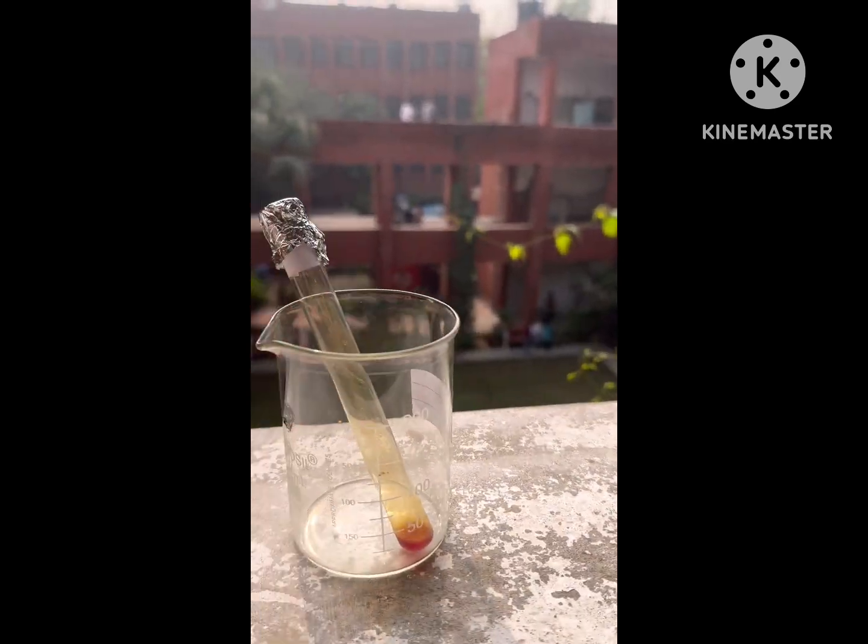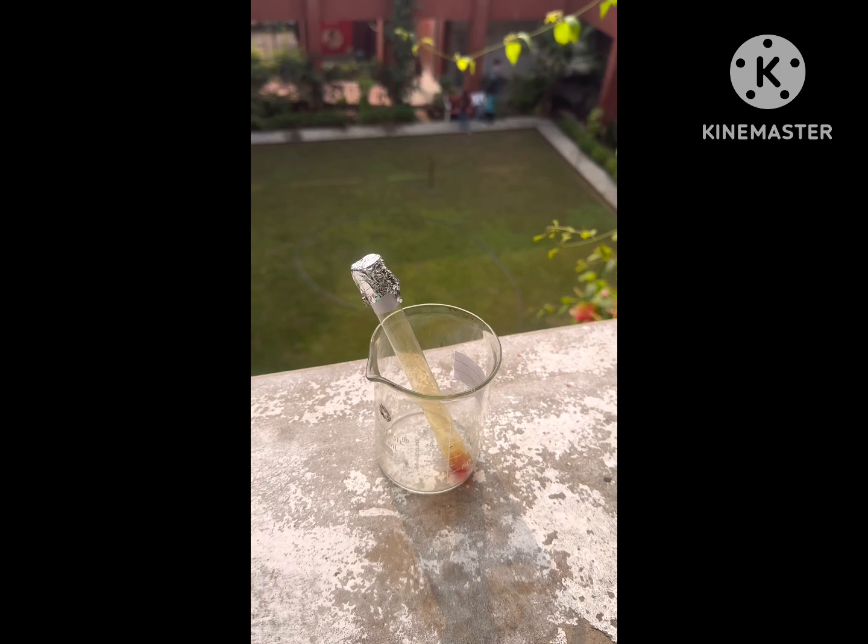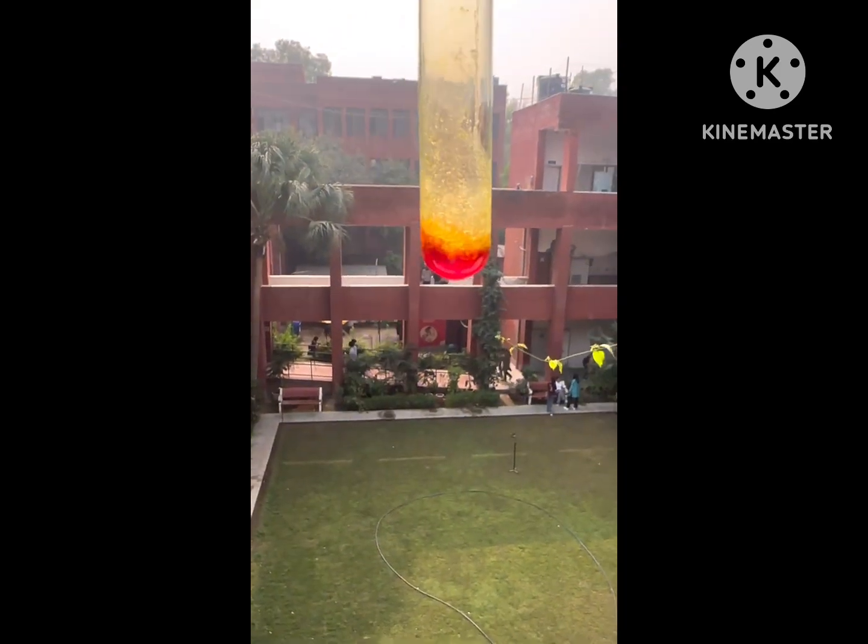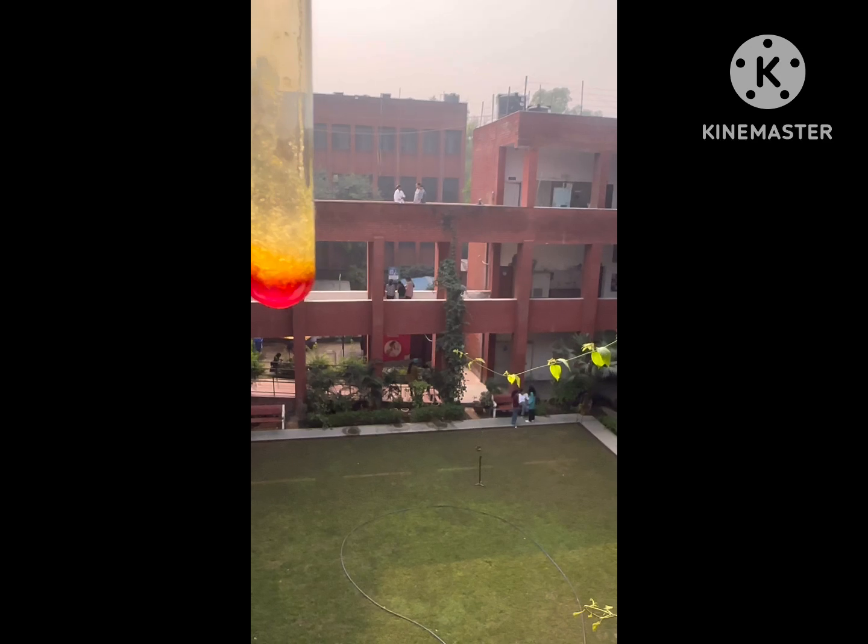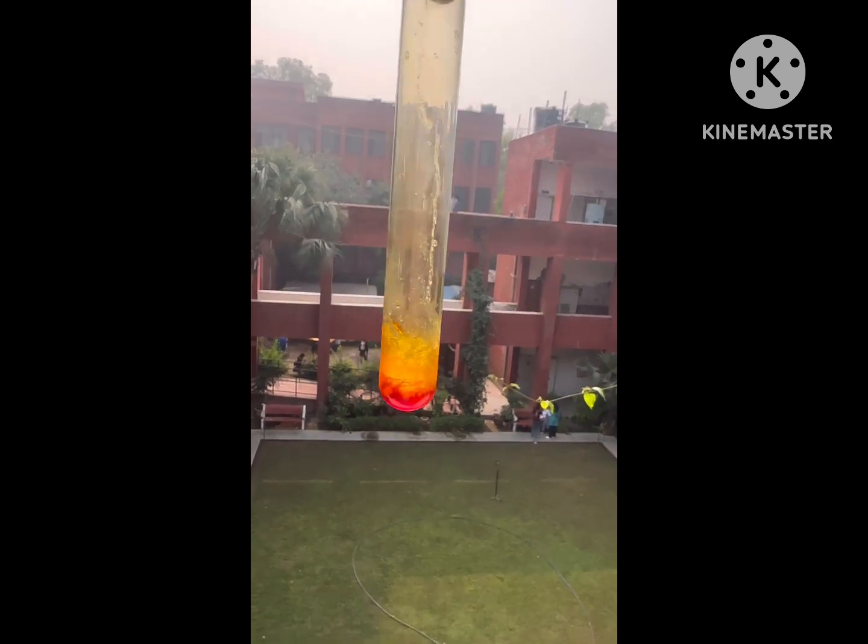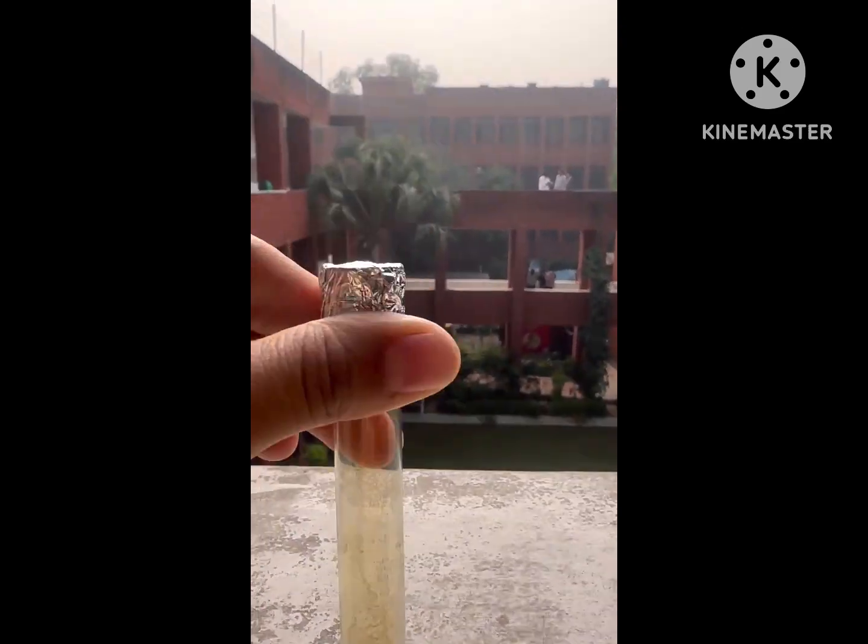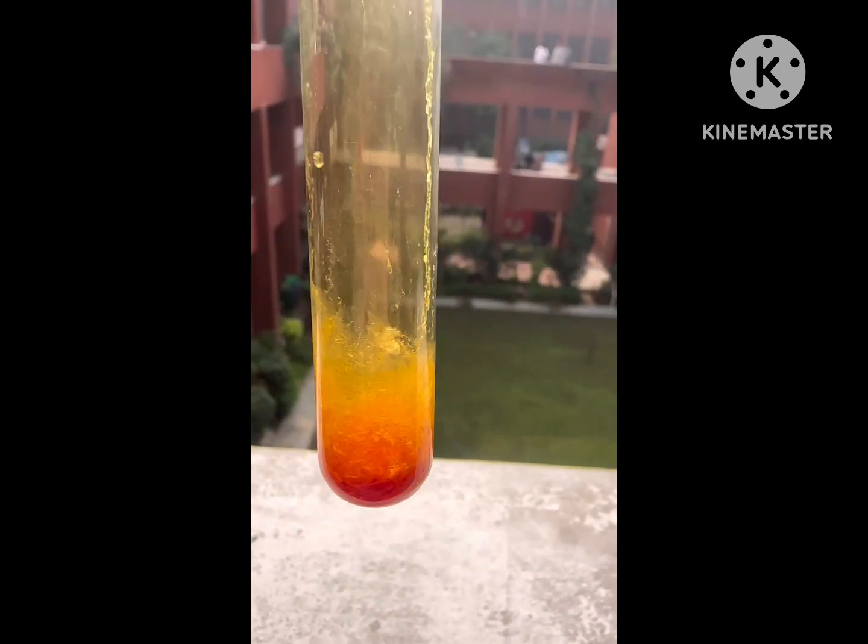Now this reaction is kept in sunlight and within few minutes solid starts forming. You can see here in the test tube a solid has appeared. This is dimethyl fumarate has formed. So this solid formation takes place within few minutes.